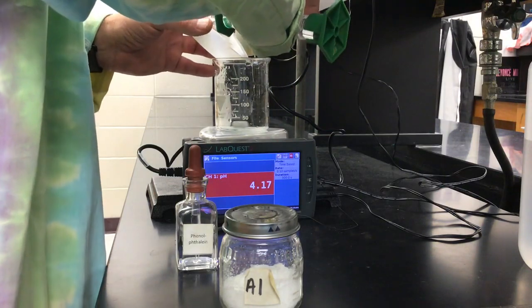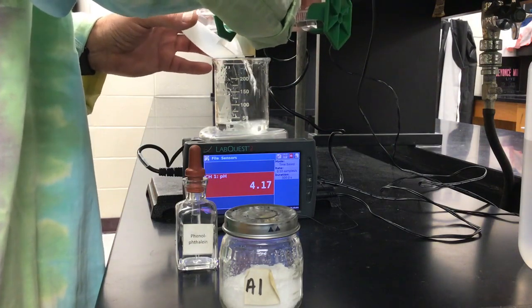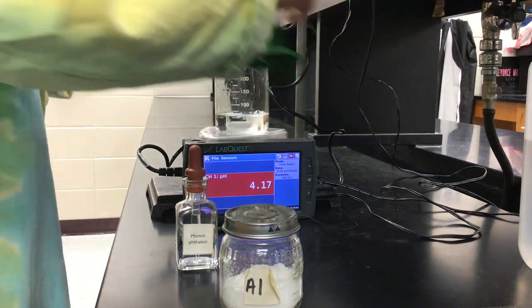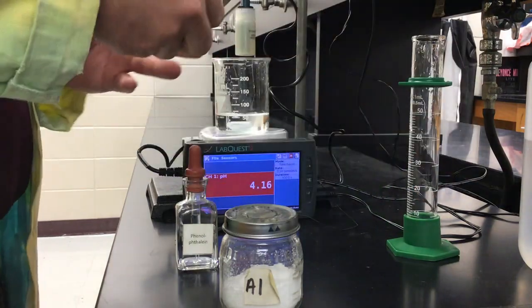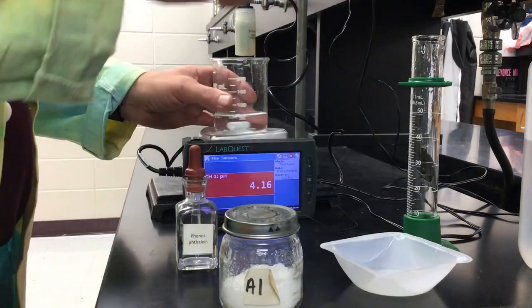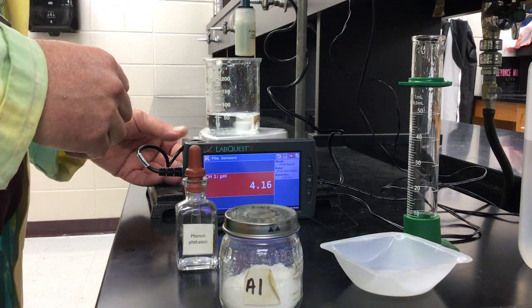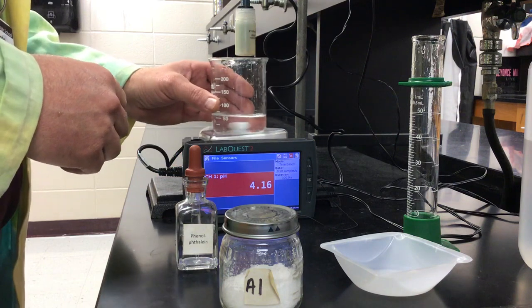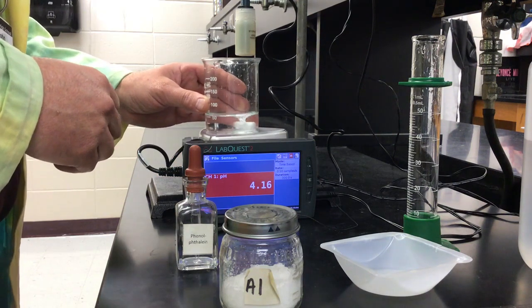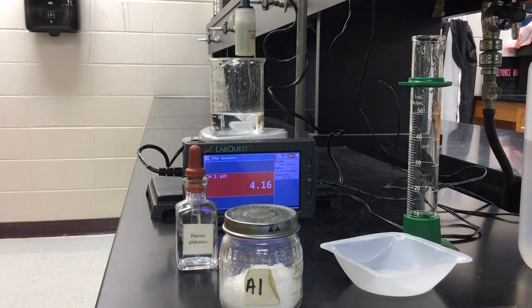But I'm going to go ahead and pour this in here and mix my weak acid solid with the water into solution. And I'm going to turn on the magnetic stir bar here just a little bit to mix that up. It takes a little bit to get these weak acids to dissolve in solution. Takes a minute or two, so I'll show you what's going on here while we're waiting for that to dissolve. And I'll give you a closer look at the setup in a second.